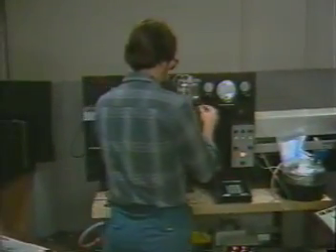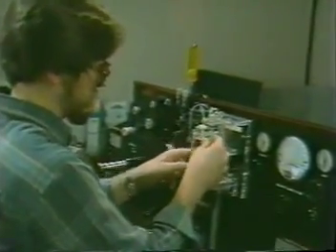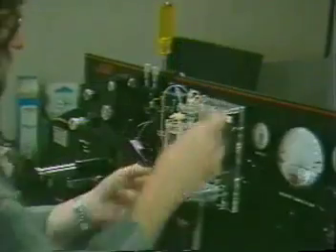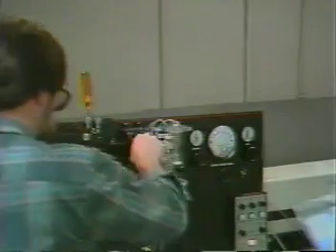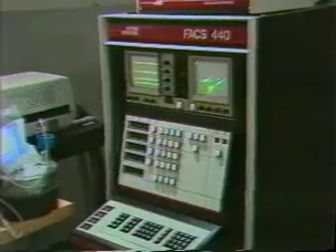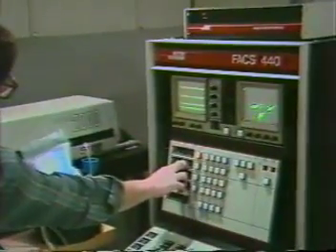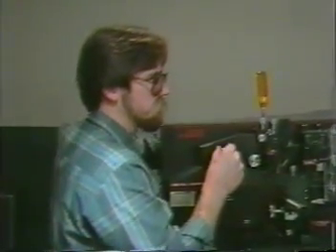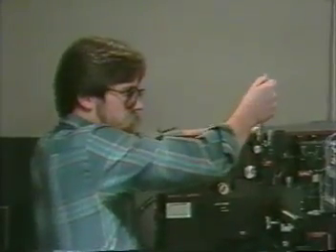FACS Desk provides a FACS calibration routine which aids the operator in setting each FACS channel to a consistent standard. Proper use of this routine will assure that data collected from one session to the next can be accurately compared. To carry out this standardization, Keith is running a set of specially calibrated beads through the FACS. He is familiar with the dot patterns that the beads should generate, so he can bring the FACS into rough alignment by watching the oscilloscope screen.